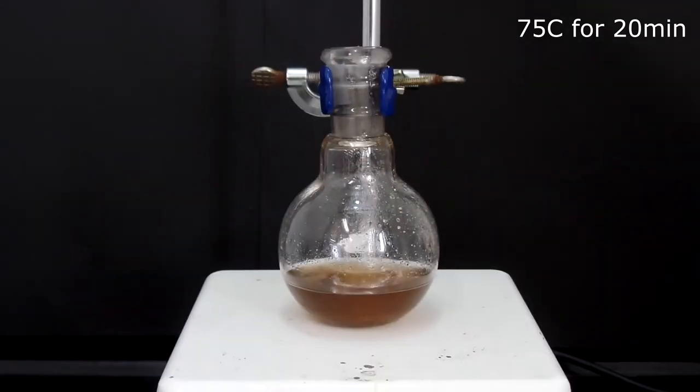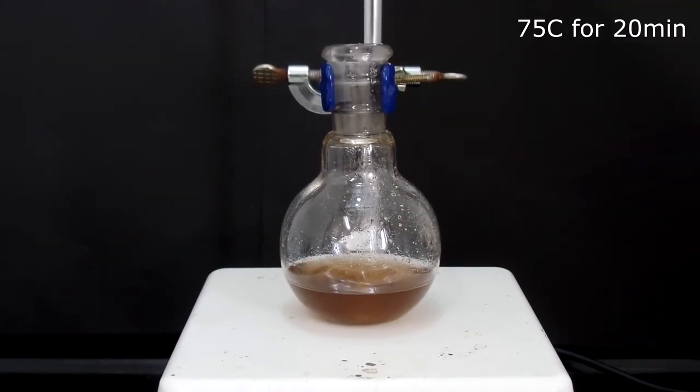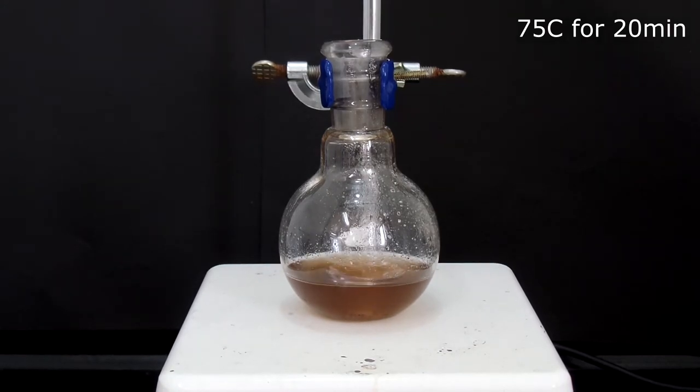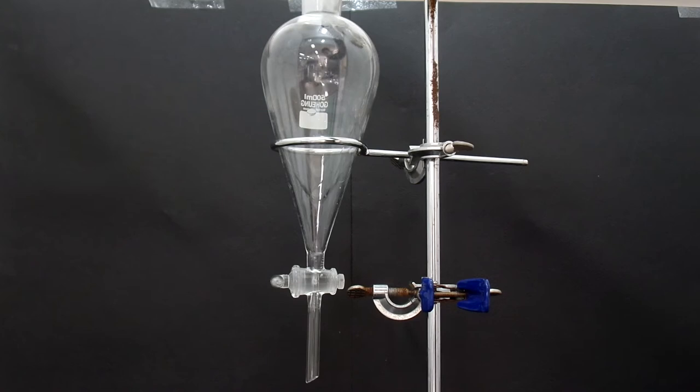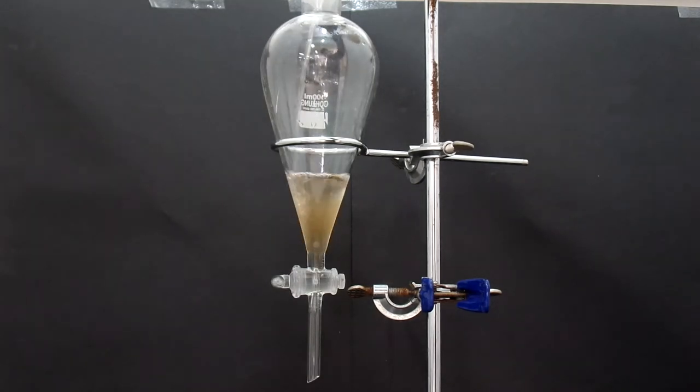After all the addition, I heated the whole mixture at 75 degrees Celsius for 20 minutes. After heating for 20 minutes, 30 ml of ice cold water was added and transferred to the separatory funnel.